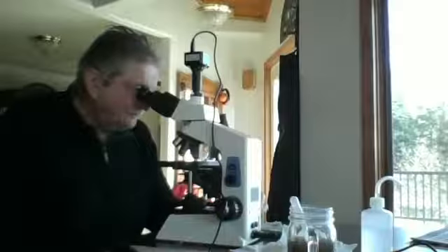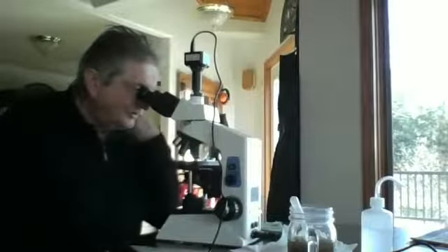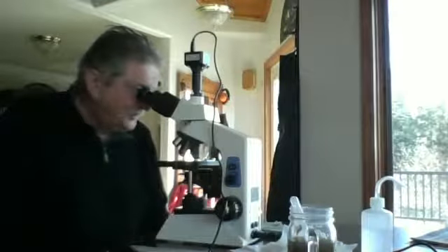And I can't tell at this 400 magnification, but it looks like there'd be tiny flagellates in here. Looks like I count about 4, but I cannot see their little flagella. They're about 3 to 4 micron in size, certainly not cocci and not Coccobacillus.